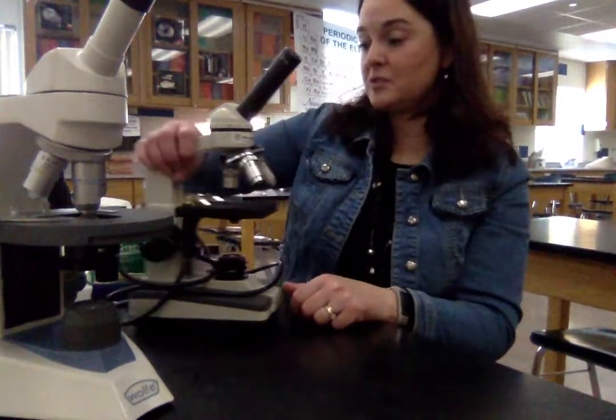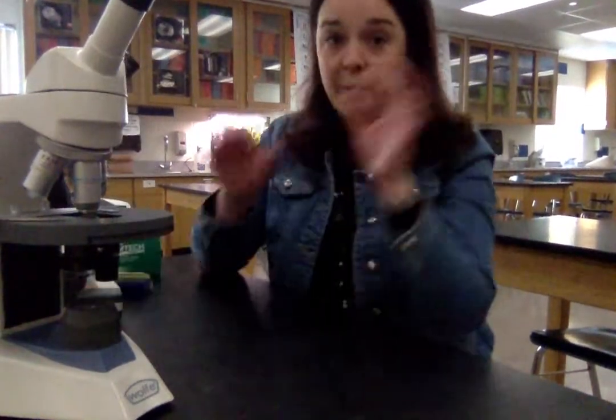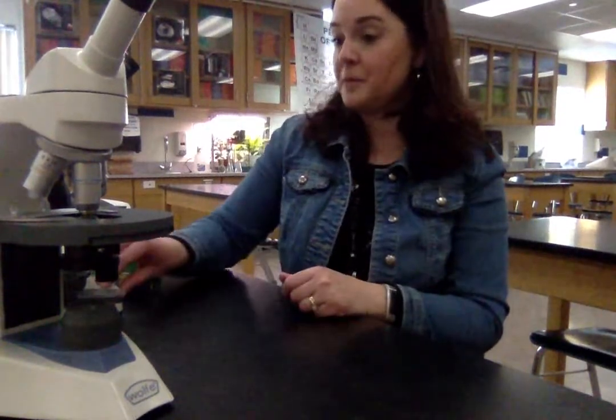Almost all eyepieces in the classroom microscopes are 10 times magnification. Even if you have a microscope with two eyepieces — binocular viewing — they both have 10 times magnification. It doesn't change the total magnification.